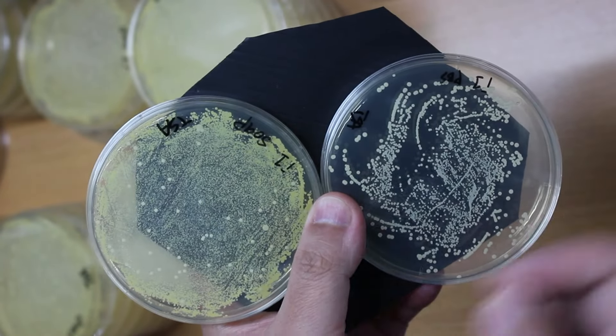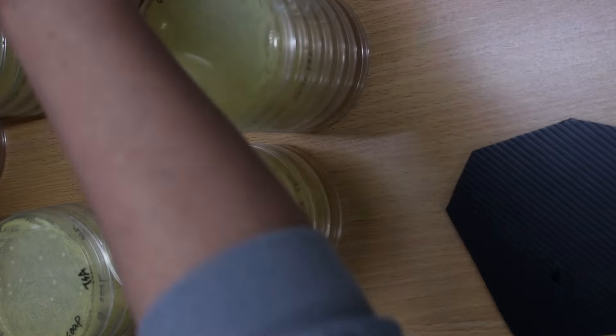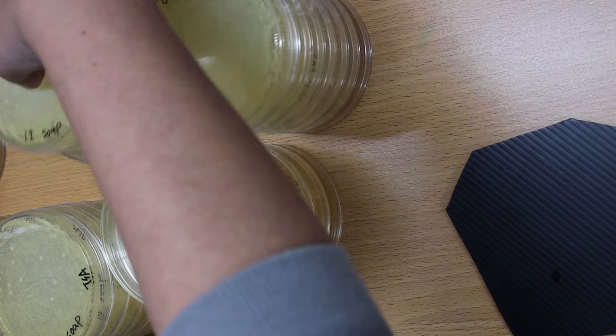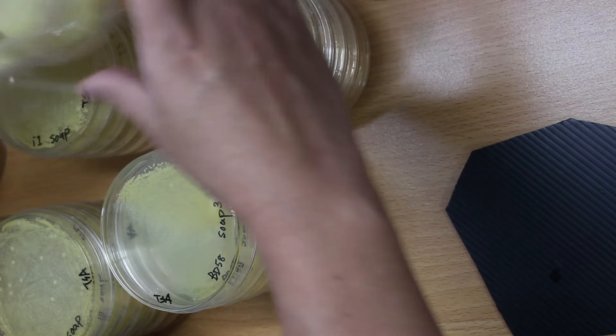So here I think the soap does not kill bacteria. But I do notice that the colony becomes smaller and also they grow much slower. So the soap actually did something to the bacteria, it's just not enough to kill them.